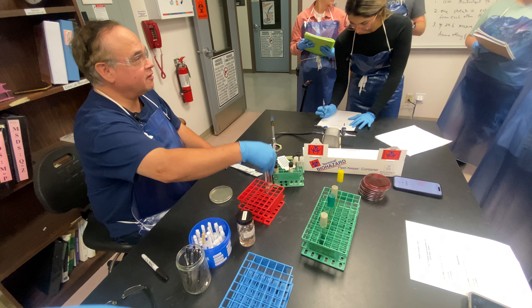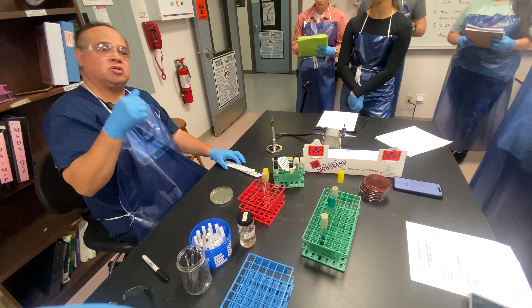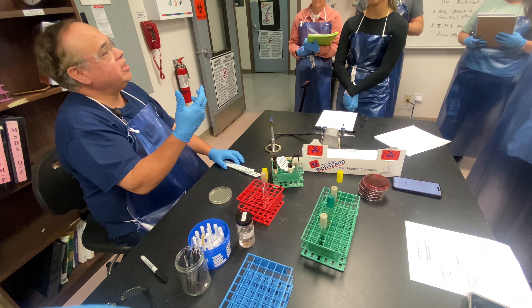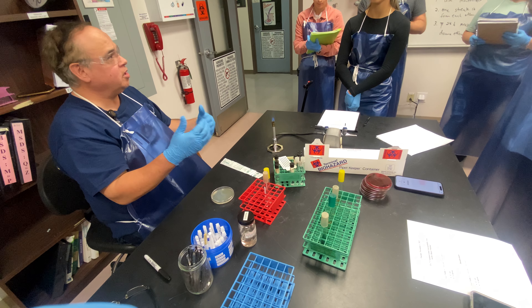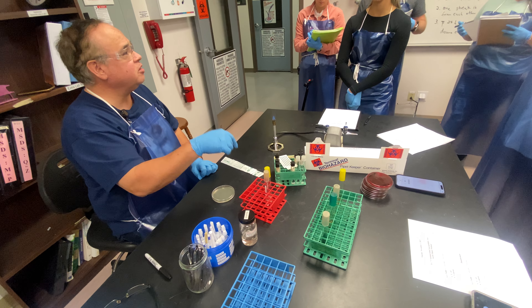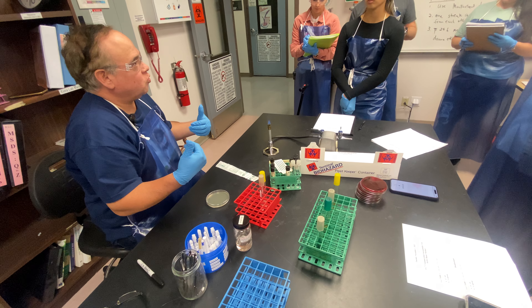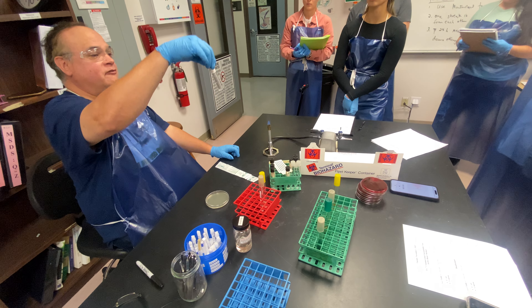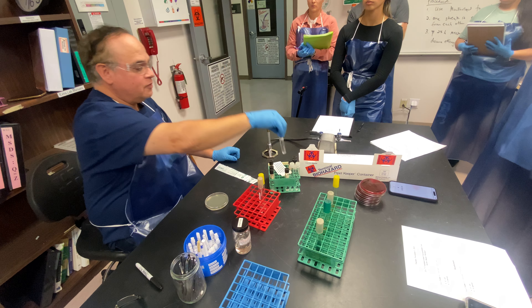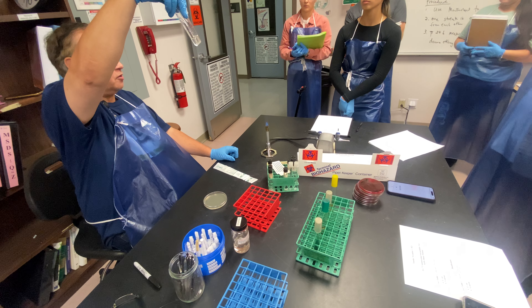In order to make sure that I have the proper population, Myra has already made for us some McFarland standards of these organisms. When we think about how much organism we're putting into a plate, it's about turbidity — turbidity is really the concentration of organisms. The more turbid, the more concentration we have. Usually when we get organisms at our desk on a daily basis, we have about a concentration of what we would call a six or a seven McFarland. This is what a half or 0.5 McFarland looks like — it's not very strong at all, and that's the population we want. We want either a 0.5 or a one McFarland.